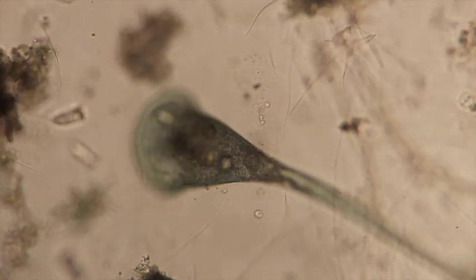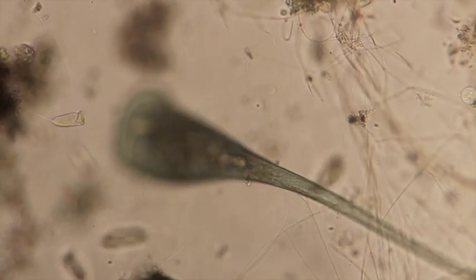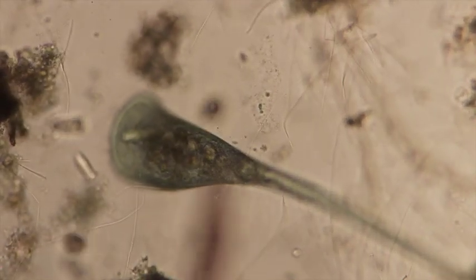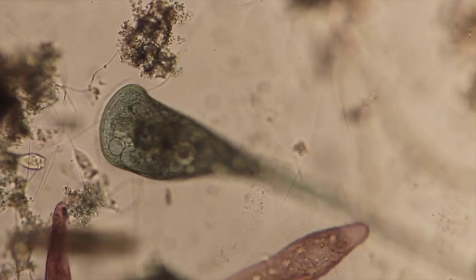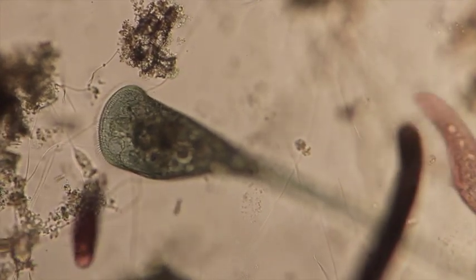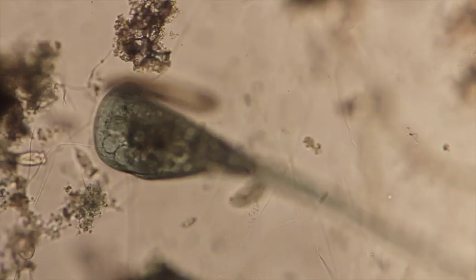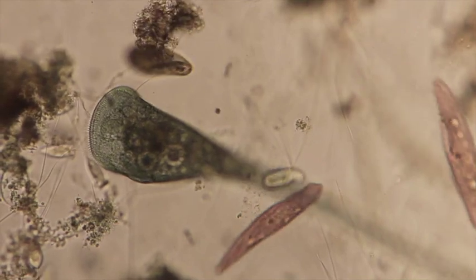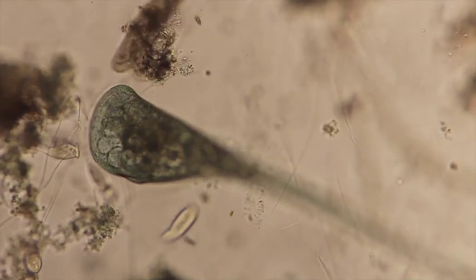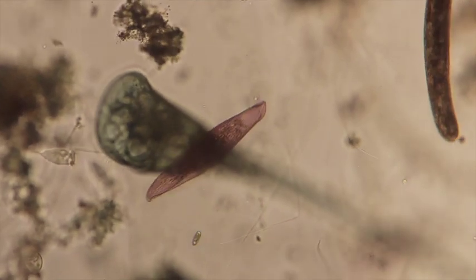But he's a ciliate. You can see the cilia around its mouth. Okay, we'll just focus in. There's a vorticella next to it that we looked at earlier. It basically is similar to a vorticella, only a lot bigger and eats a lot bigger stuff. And we can see it here very well. You can see all that cilia around its mouth. Then the stentor will beat its cilia.